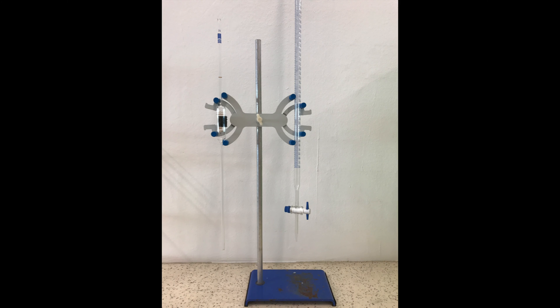Both the burette and the pipette are to be washed with deionized water, followed by rinsing with the solution they are going to contain.